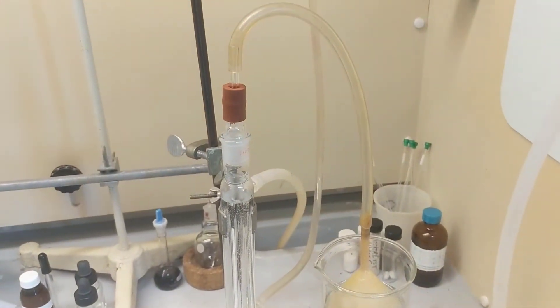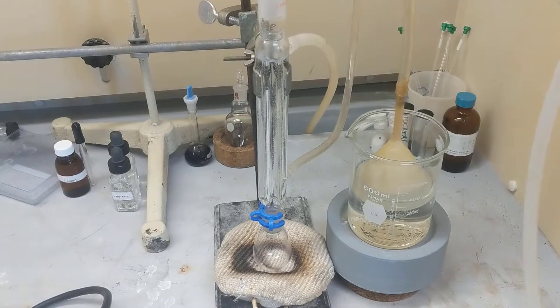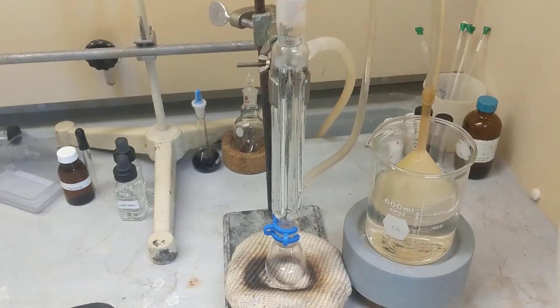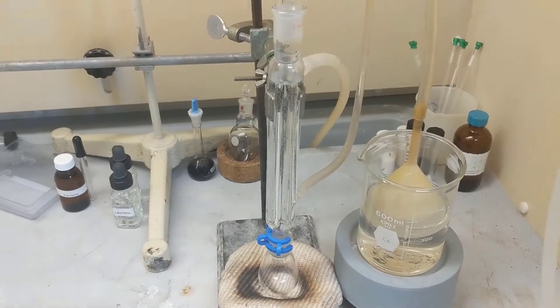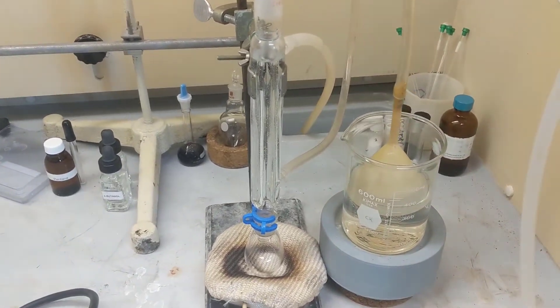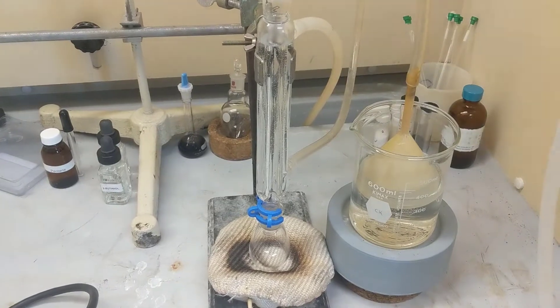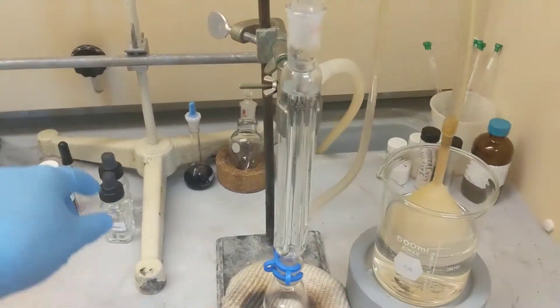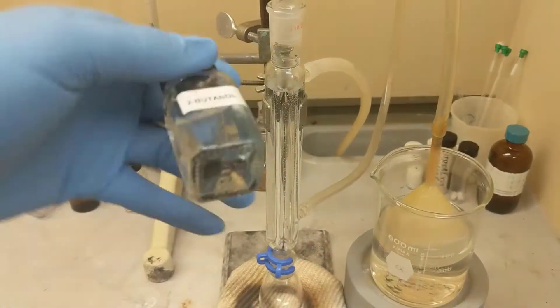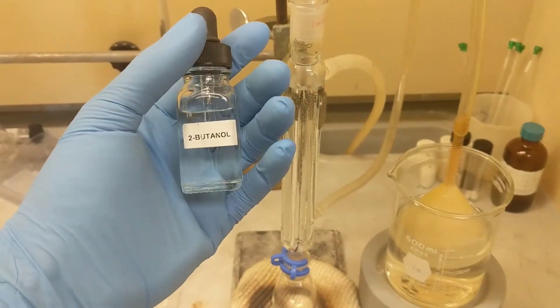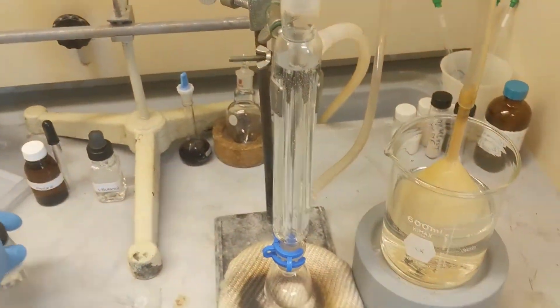I'm not sure what they'll have you do with this. They might have you using a cotton filter at the end. Make sure to keep your hoods closed, wear your gloves and goggles and masks, because these halides are no joke. Stay safe while you're using them. For 20A we're going to be using 2-butanol, and we're going to go ahead and get started.